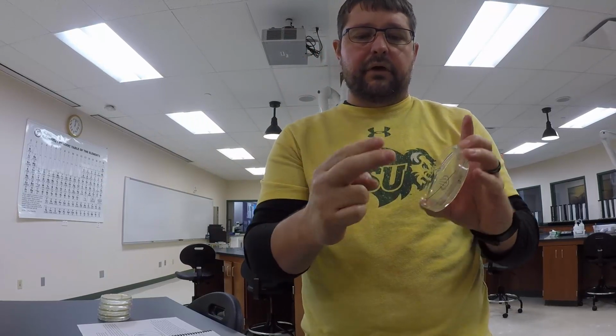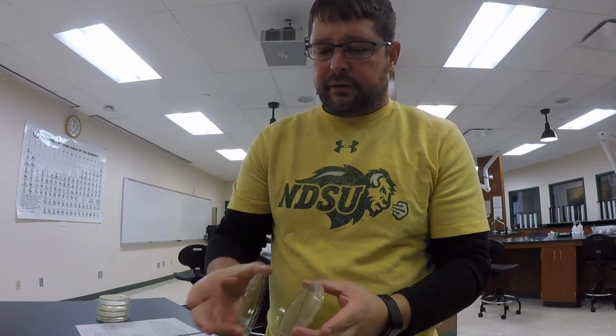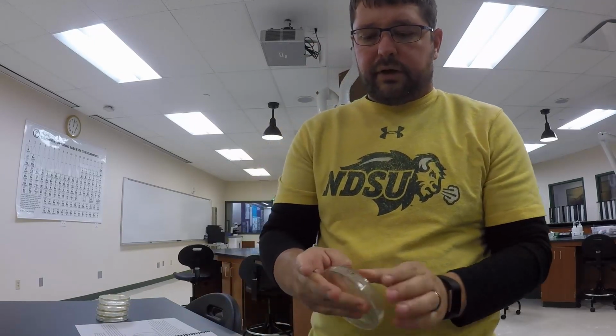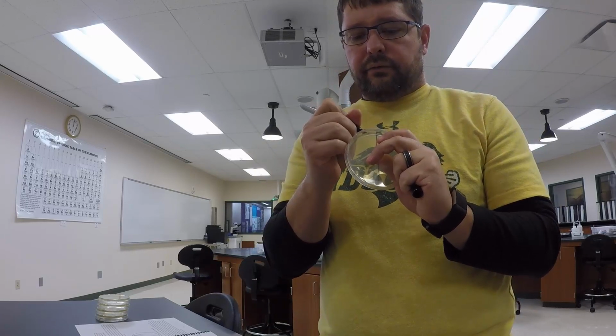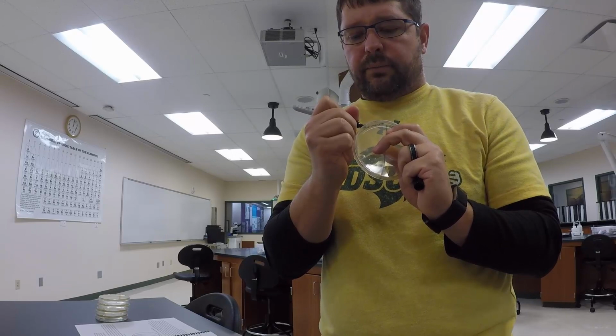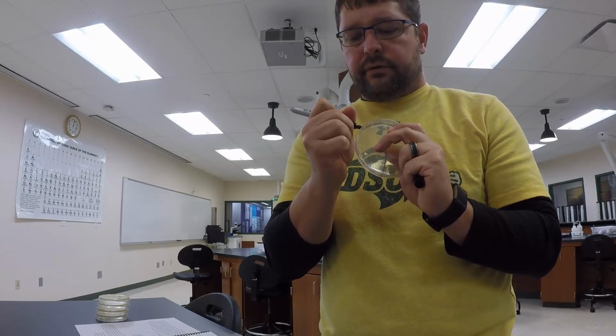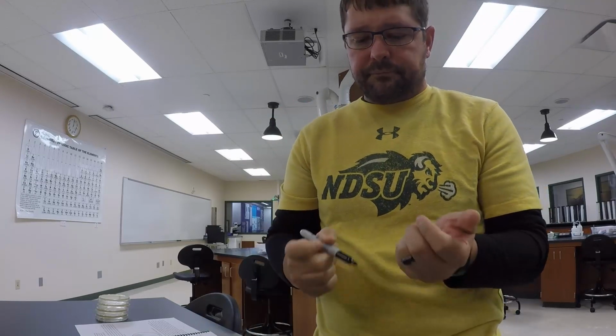So you can either look at males versus females. Okay, so I'm going to remove it with that hand. So this is still clean. I haven't touched anything with these 2 fingers. Then I'm going to run it down the other side. Okay, now I'm going to write clean on this side and note that I used hand soap to clean it with. Okay?